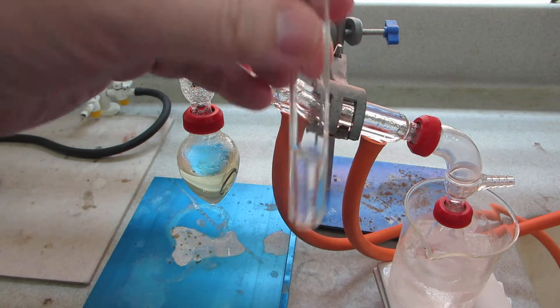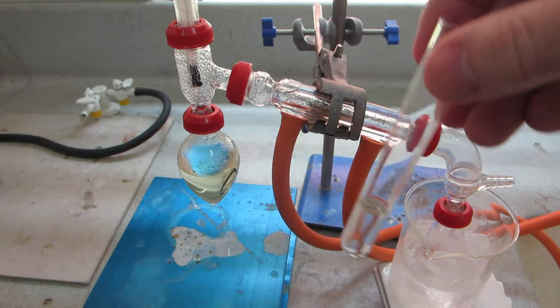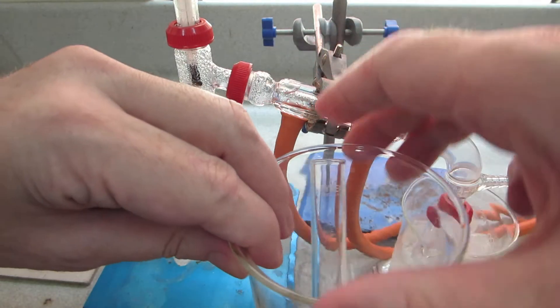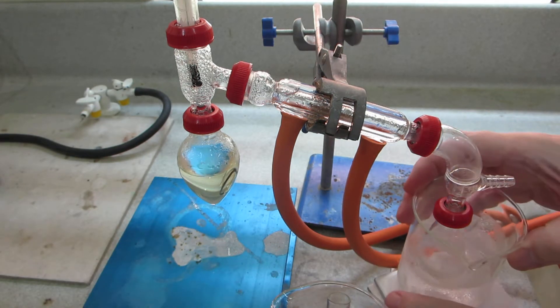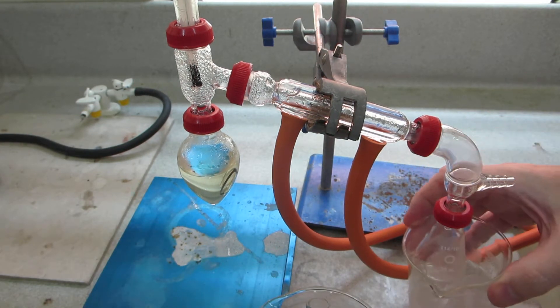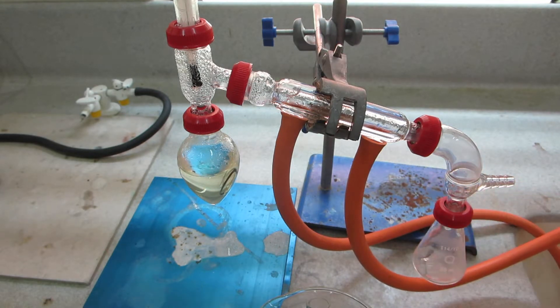So into that, let's just leave that in a beaker here at the bottom for a second. Into that we're going to introduce our product. We haven't got very much, so we might end up using all of it today.